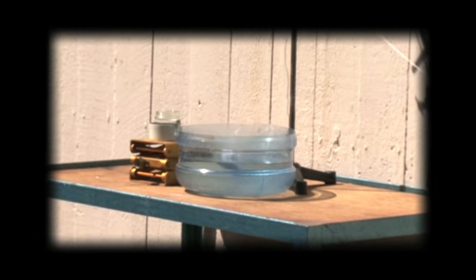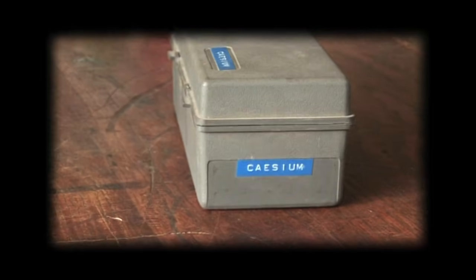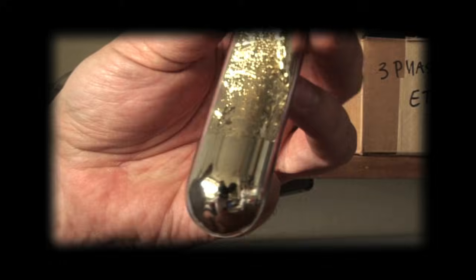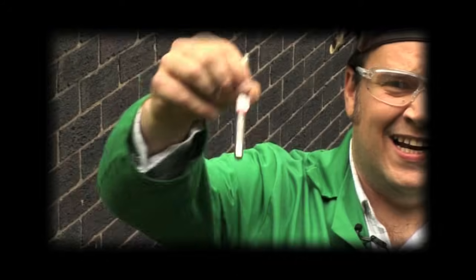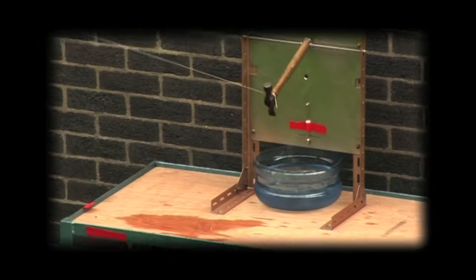We've always been a bit unlucky about the reaction of caesium in water. We've tried it several times. It's meant to go explosively, but it's always been a bit of a disappointment.